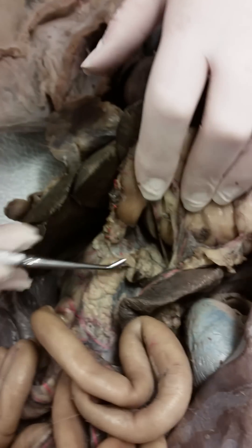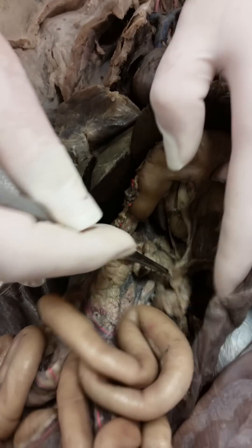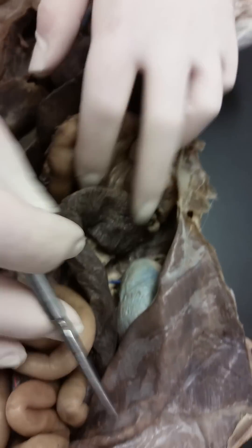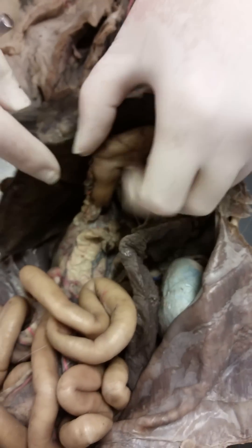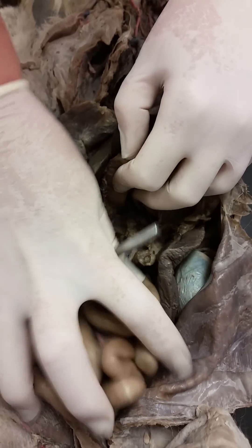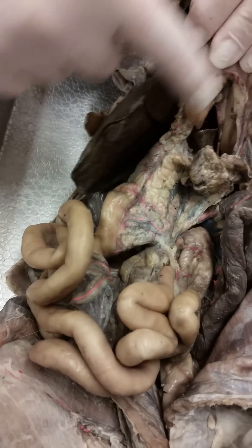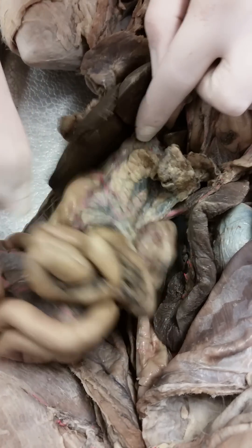We lift up the stomach, and you can see all of this — this is the pancreas. Then we have the spleen, which kind of looks tongue-like. And then we have all of the small intestines. The small intestine that is closer to the stomach, that is the duodenum.